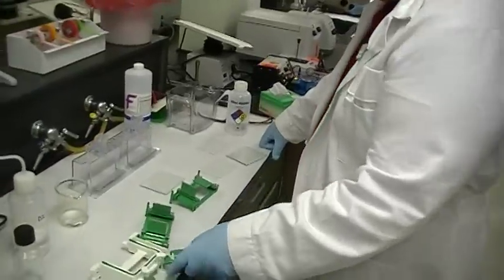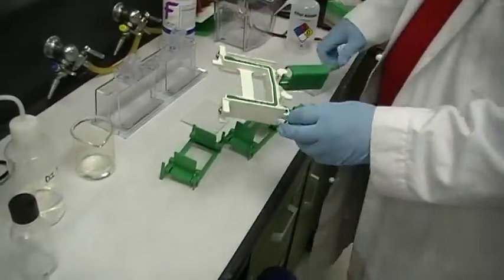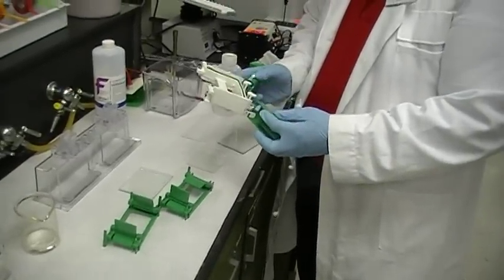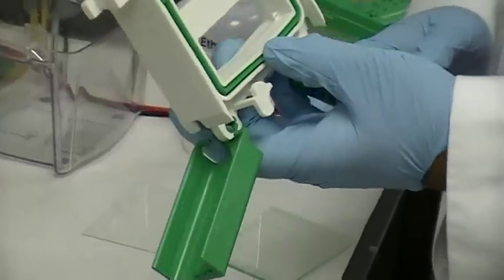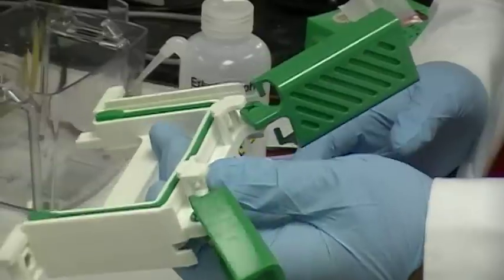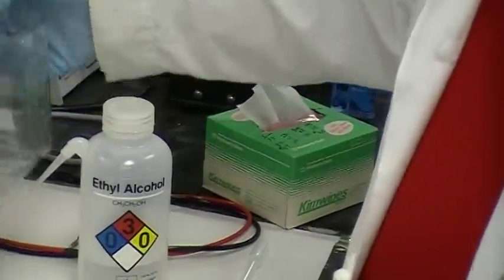This is the gel apparatus that we get from Bio-Rad. These Bio-Rad gels are very characteristic in the sense that it's green and white, and they've got this mini gel box as well.